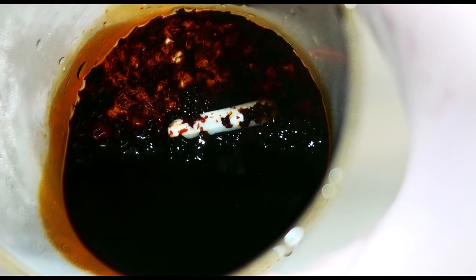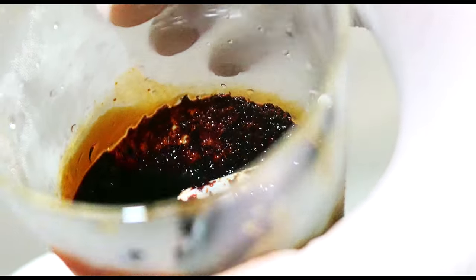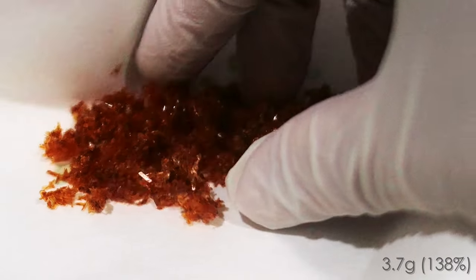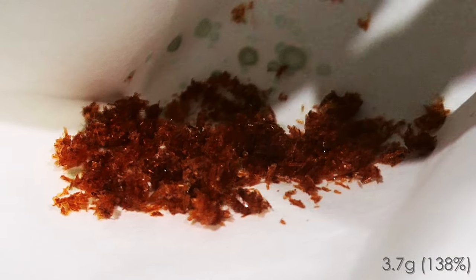These crystals are filtered, washed with ice-cold water, and dried. This yields 3.7 grams of crystals, which corresponds to 138% yield. This suggests that this is probably in a hydrated form.